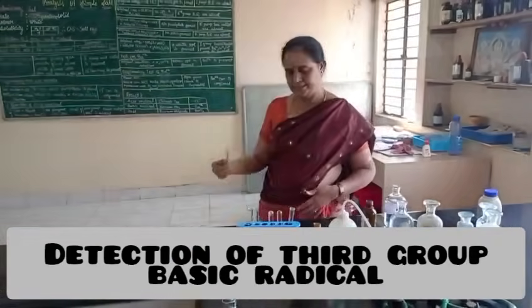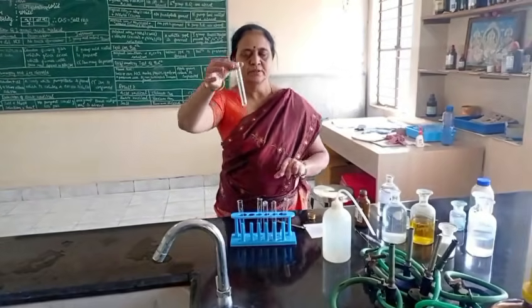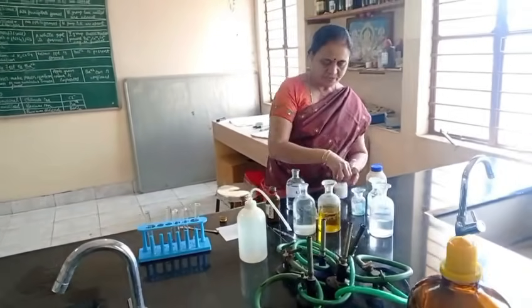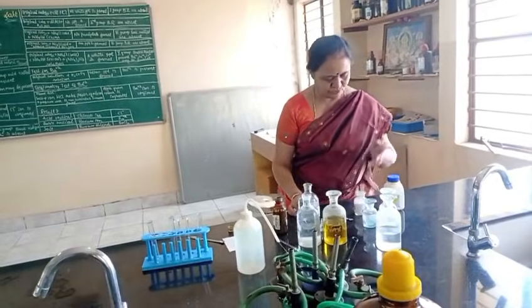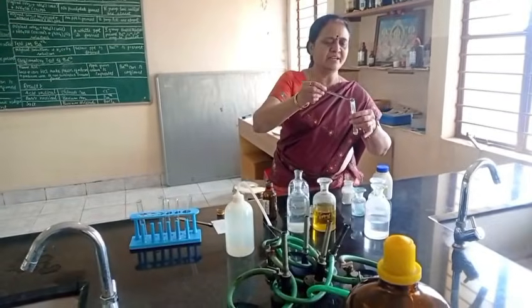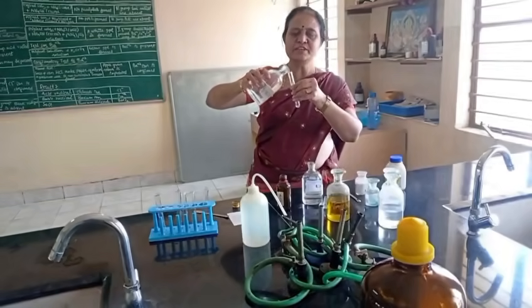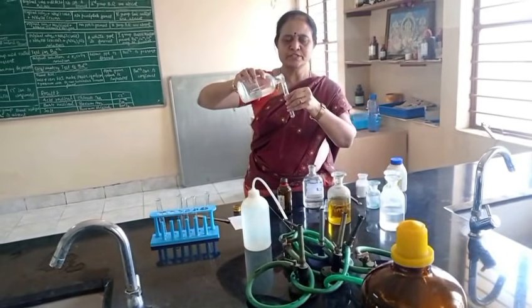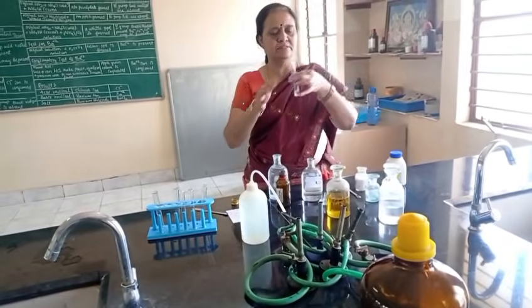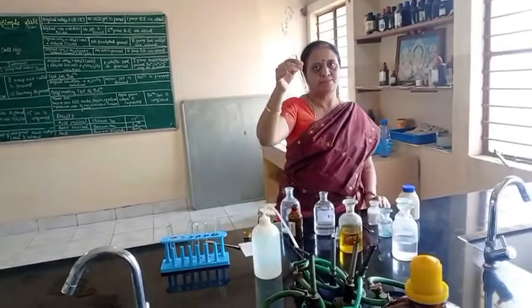Then I move to the third group. See here, for third group basic radical, I take original solution. For this original solution, I am adding solid NH4Cl, then I am adding excess of NH4OH. No precipitate. Third group basic radical absent.